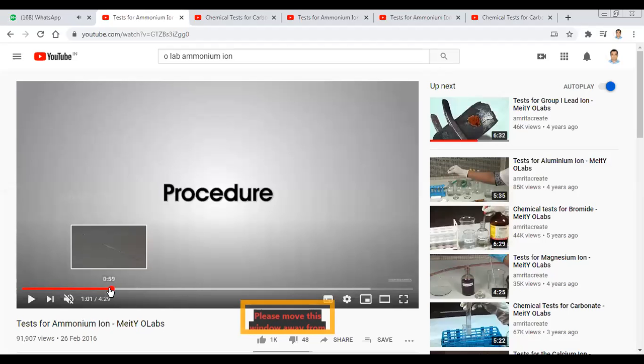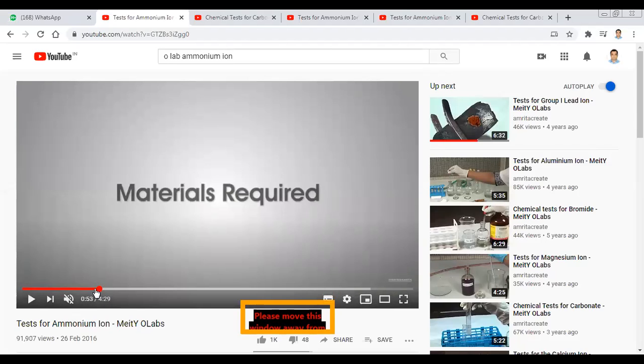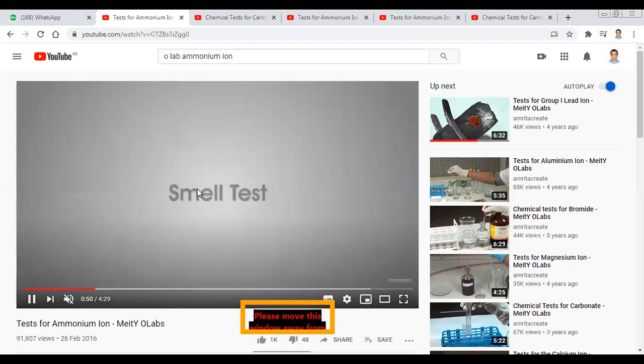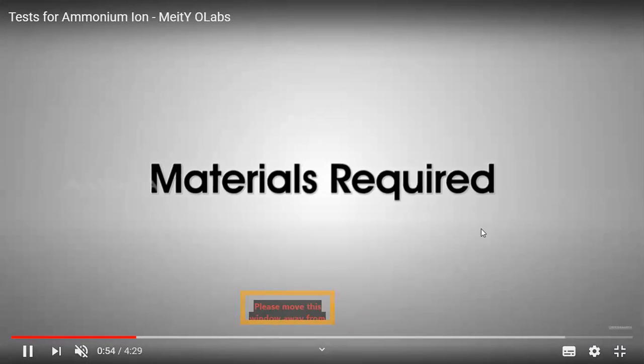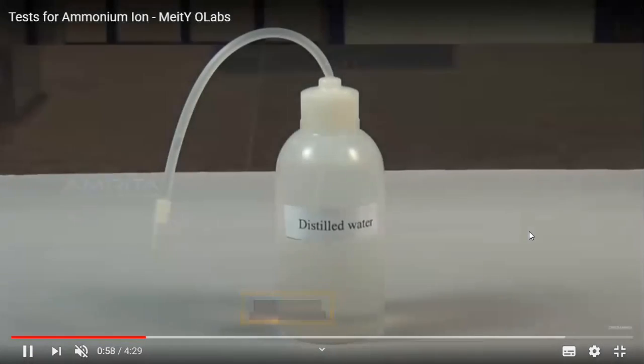Let us look at the smell test for this particular salt, my dear students. Let us perform the smell test. For the smell test, we need various materials. The various materials needed are original salt, distilled water, and a glass rod.